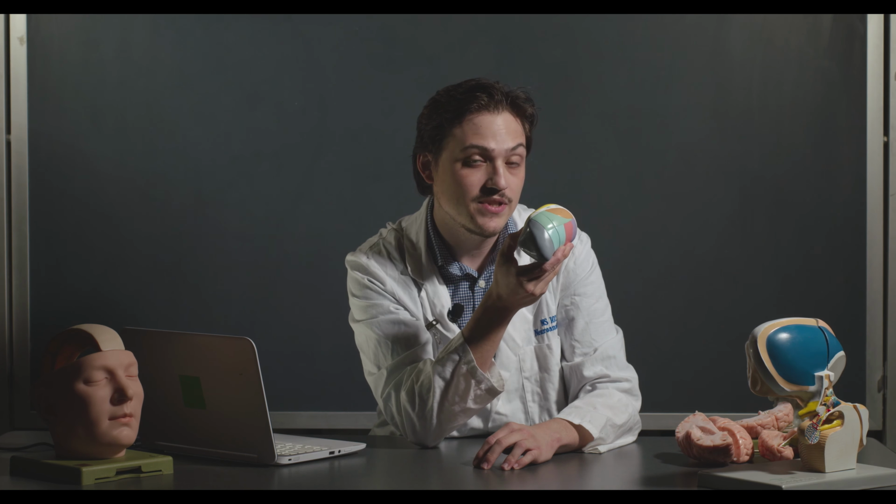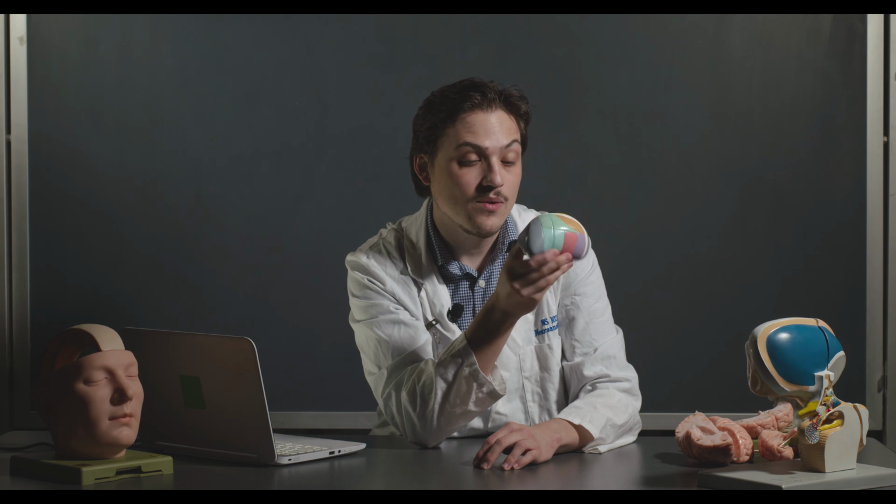Note, for your own purposes, there are 2 nuclei of the thalamus that are not represented on this model. Do you know which ones they are? Well, they're the medial geniculate nucleus and the lateral geniculate nucleus. Those are relay stations in vision and auditory information. And you actually can't see them on this model.